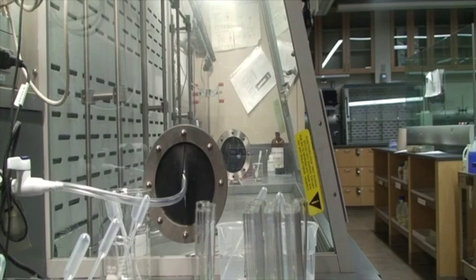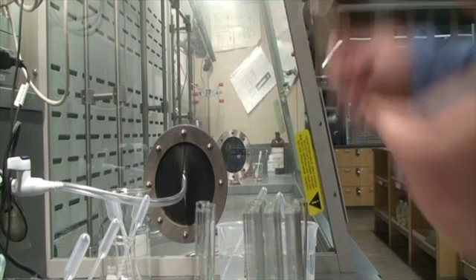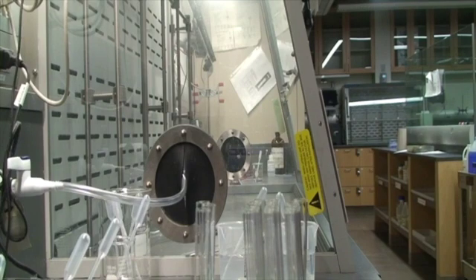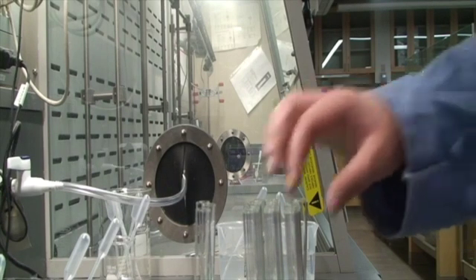I'm going to smell safely by putting a wooden applicator stick into the test tube and wafting it towards my nose. Okay, so you want to take a look at the chart in your report pages, and we're just going to do this systematically.